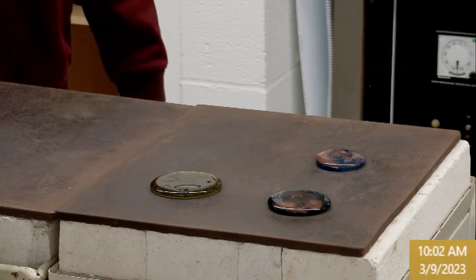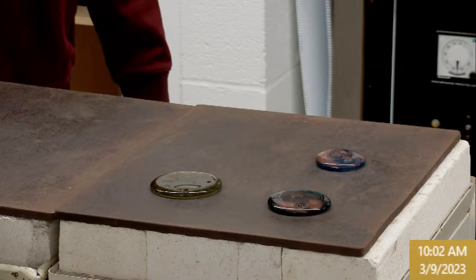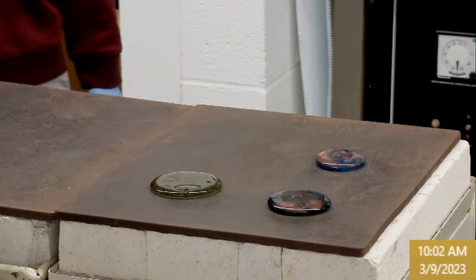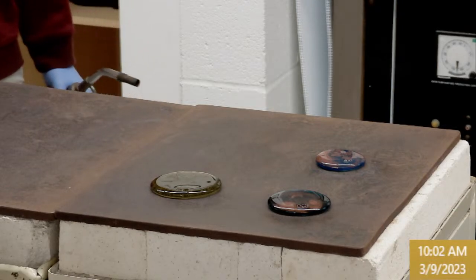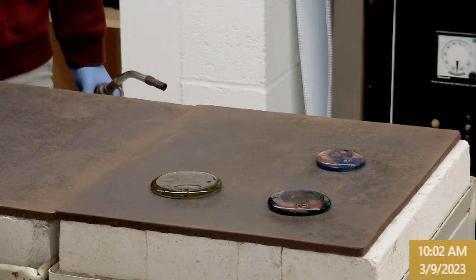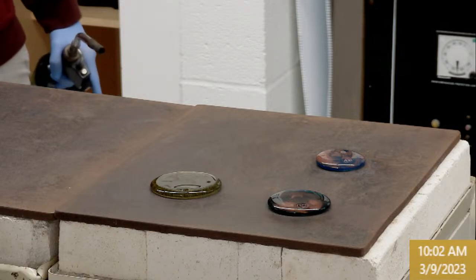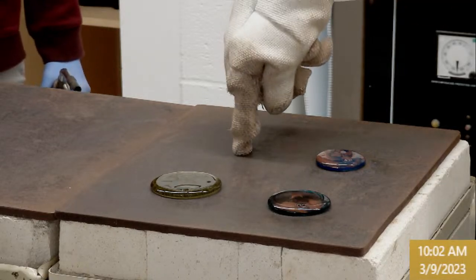But beach sand, alumina, sodium carbonate, crushed limestone, manganese purple oxide, and cobalt blue oxide. So this will be bluish purple probably, and high viscosity. This is a very bashful glass. We'll put this one here.